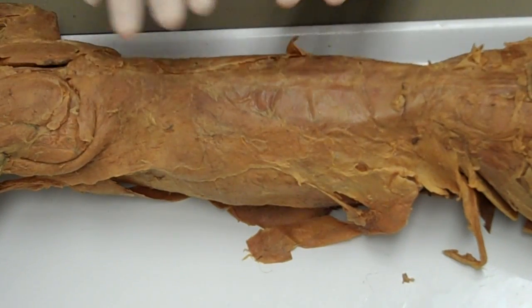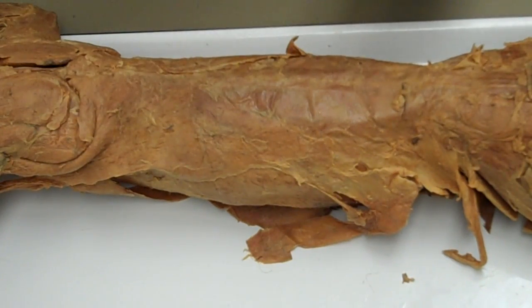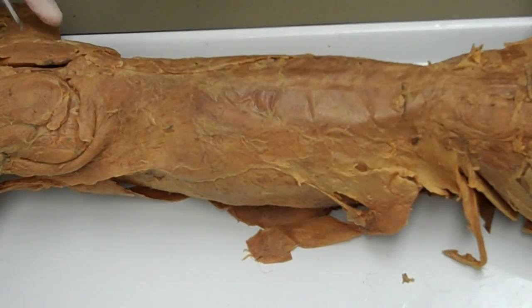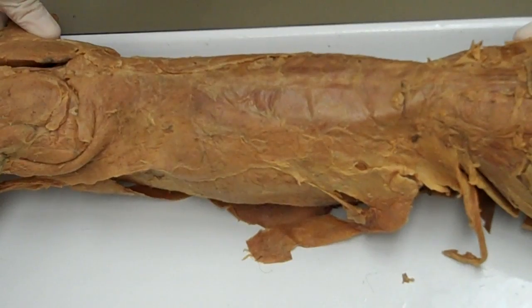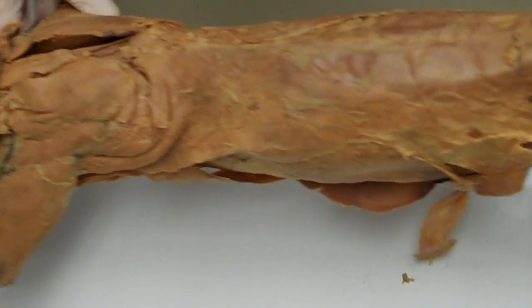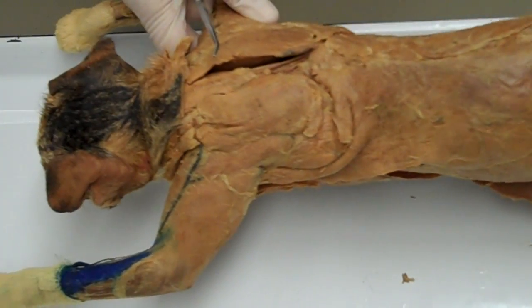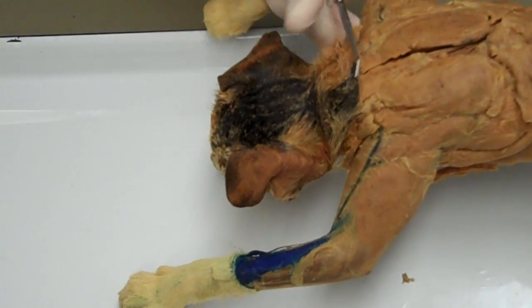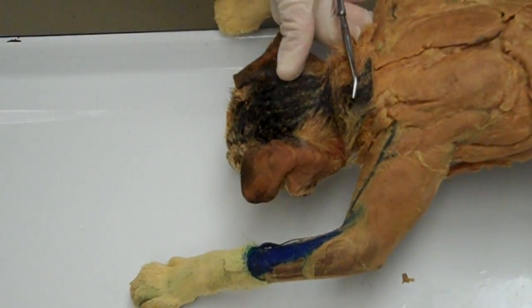I'd like to review the muscles of the back and chest. To give you perspective, we're looking at the posterior aspect of the cat. Here's the cat's head.